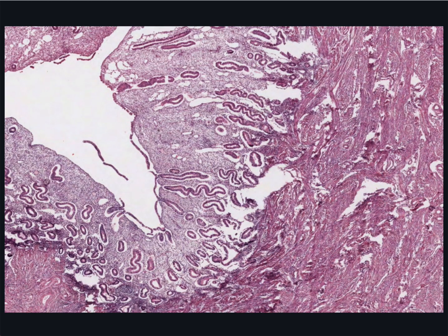The endometrium is a mucosa, although the epithelium is missing over much of the surface, again, as I mentioned earlier, due to the harsh treatment when the organ was collected and processed for histological examination. The boundary of the endometrium with the myometrium is quite obvious, but at this early stage in the menstrual cycle, it's very difficult to draw the line between the endometrium's basal layer and the functional layer.